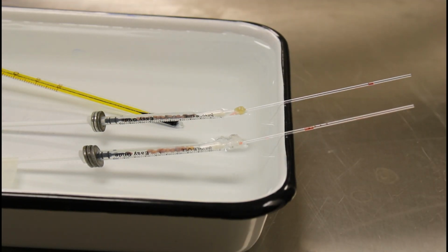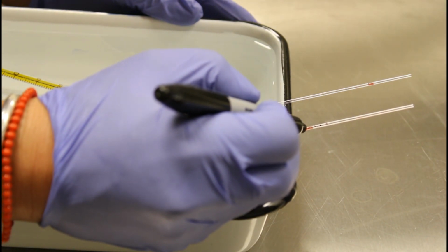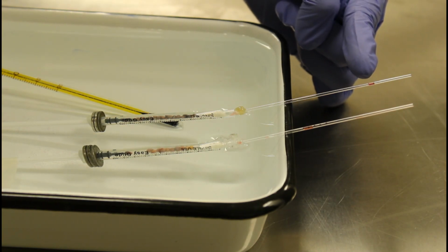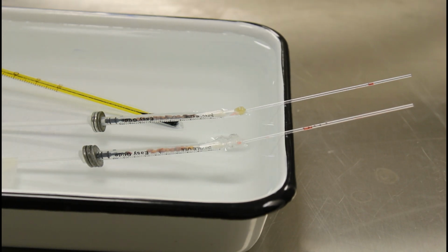Okay. So it's been just about 20 minutes since we initially put the manometer fluid into these 2 capillary tubes. So I'm going to mark the distance that the fluid has traveled so we can see that it's still moving in our treatment. And we can see that in the respirometer with the dead seeds, we have no movement. So the temperature of the water bath has not changed, so that partially explains why we're not seeing any movement. That's good, that these have both been under a consistent temperature throughout the entire experiment. So this was our 20-minute reading. We're going to check in on this one more time in 5 minutes.